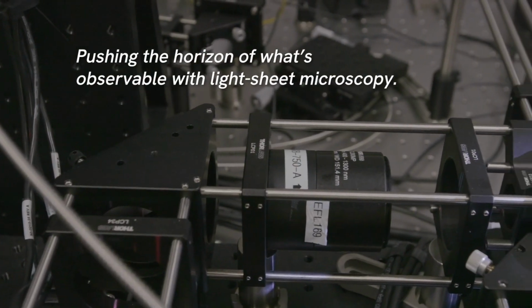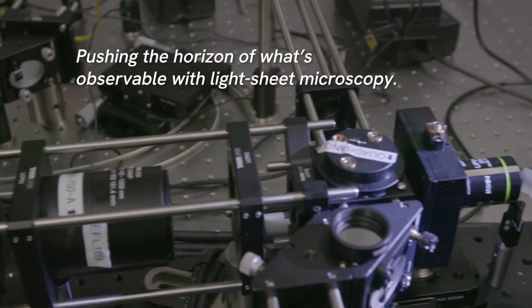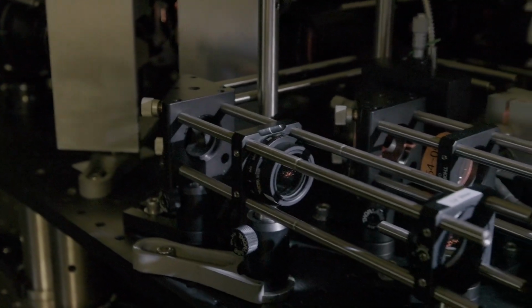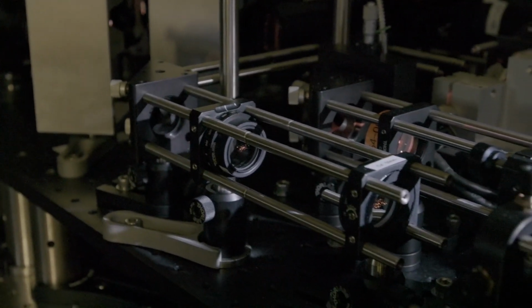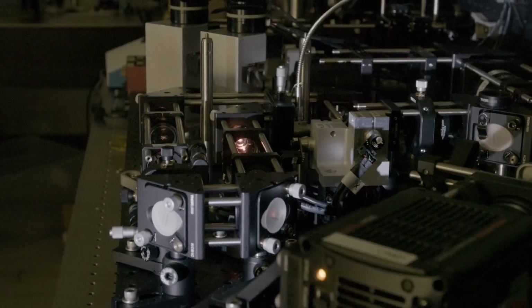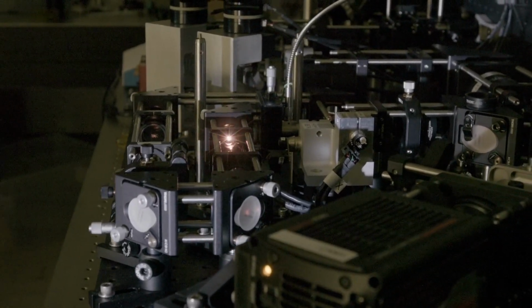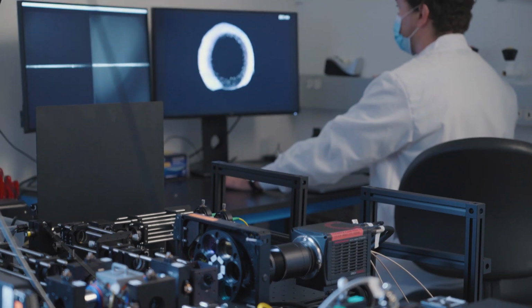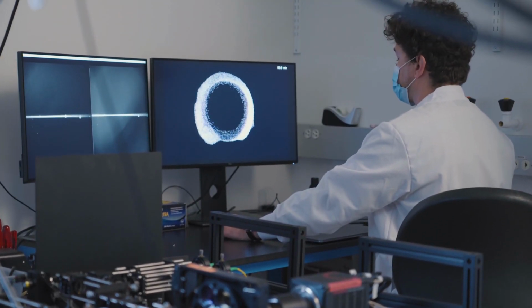Light sheet microscopy has been a powerful method to be able to see faster, deeper, and at higher resolution inside of living organisms. You basically have your zebrafish embryo, and you traverse it with a sheet of light. You move that sheet of light throughout the zebrafish embryo and create a 2D image. And by combining all these 2D images together, you get a 3D image.